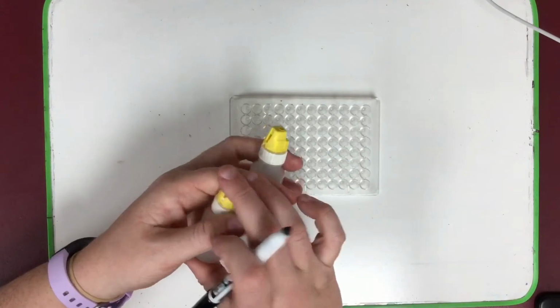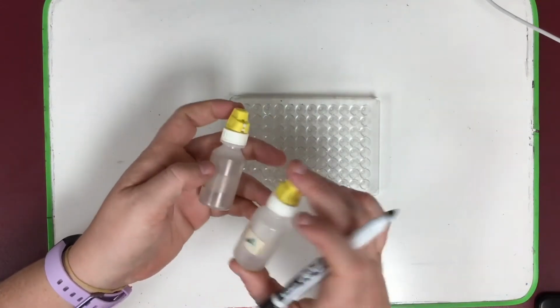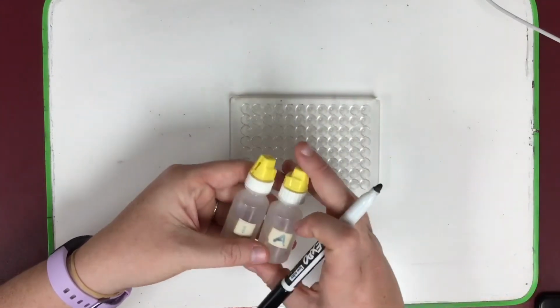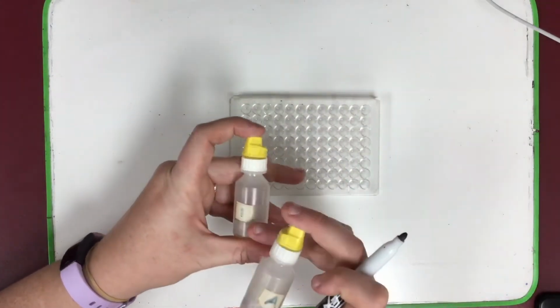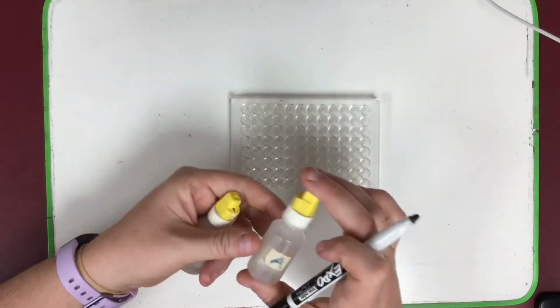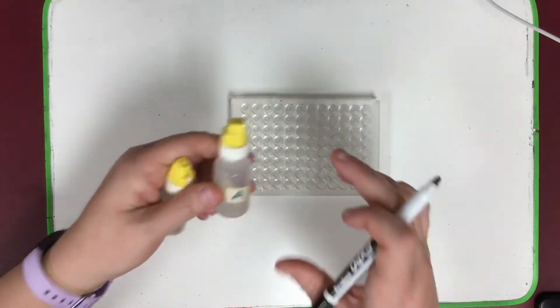He then grouped them based on how they reacted with oxygen. We're instead going to group based on how they react with letter A, B, and C. But to make our lab a little bit easier, we're going to only focus on 9 numbered solutions. Those are our unknowns. And we're going to react each of the 9 with A, B, and C.